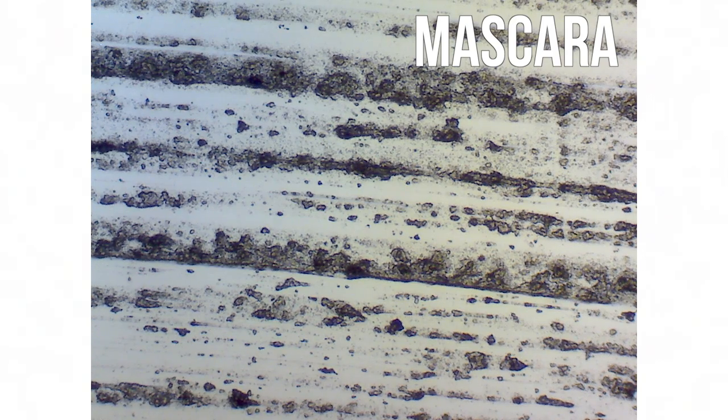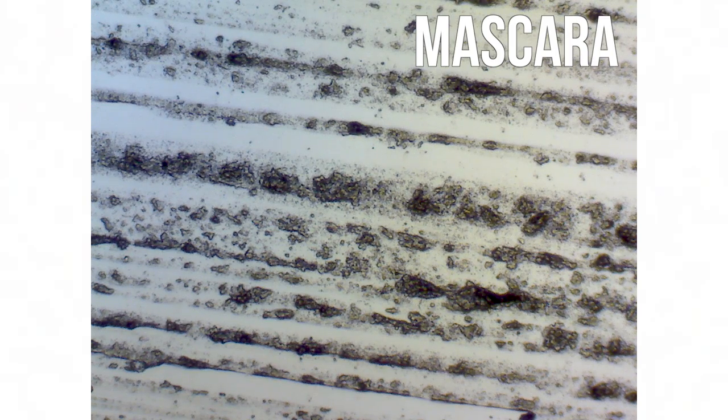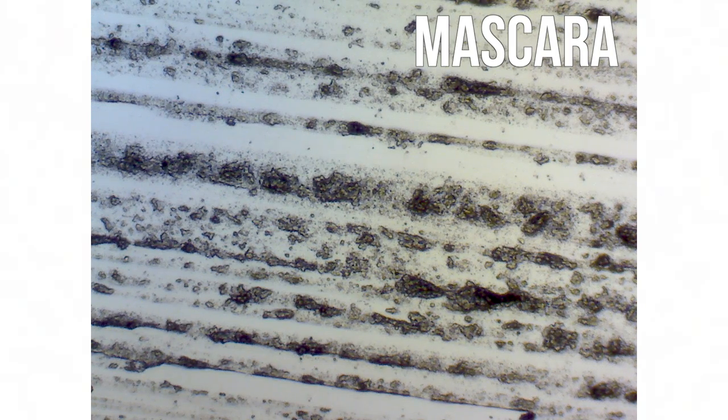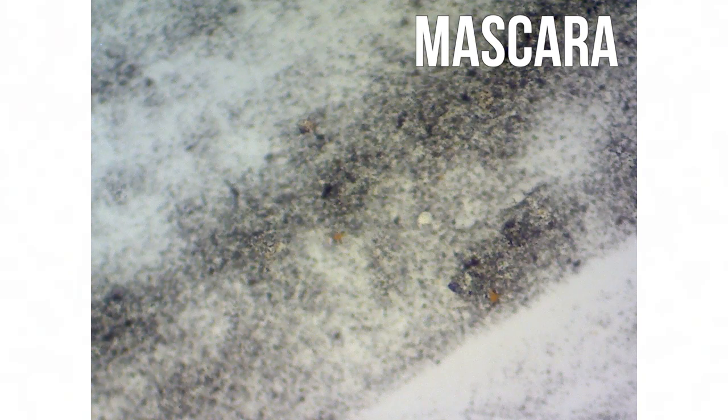Finally, here is my mascara. The majority of my makeup didn't appear to have any bacteria, except for my mascara, which had these little yellow dots. This is why it's important to follow the guidelines on when to throw away your makeup.